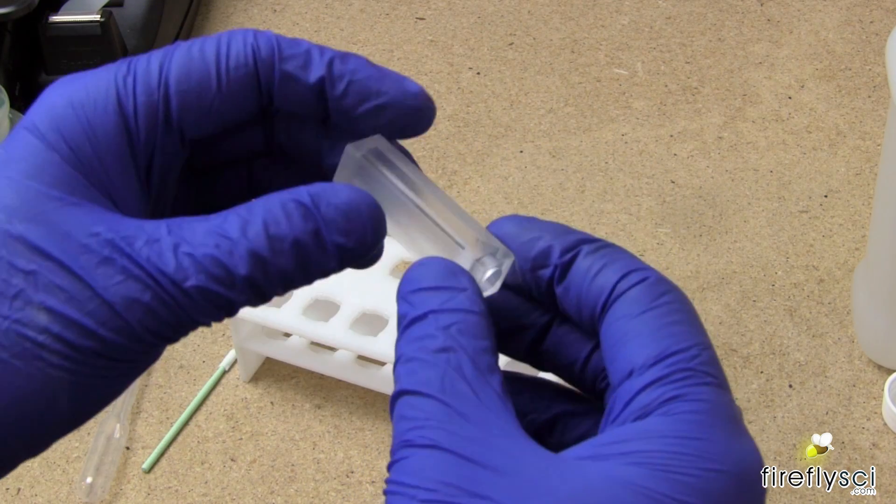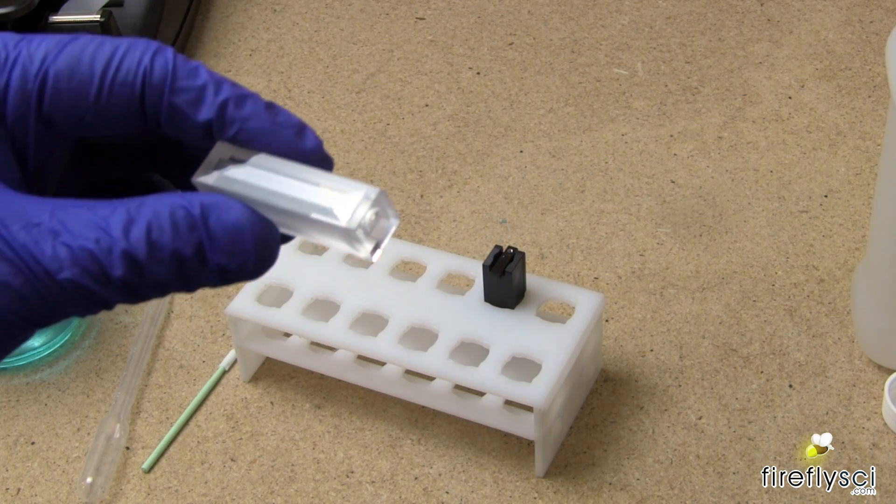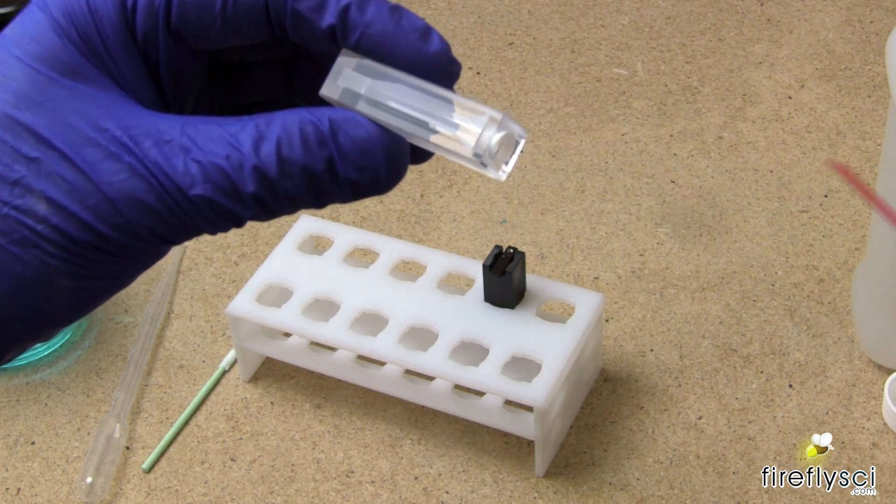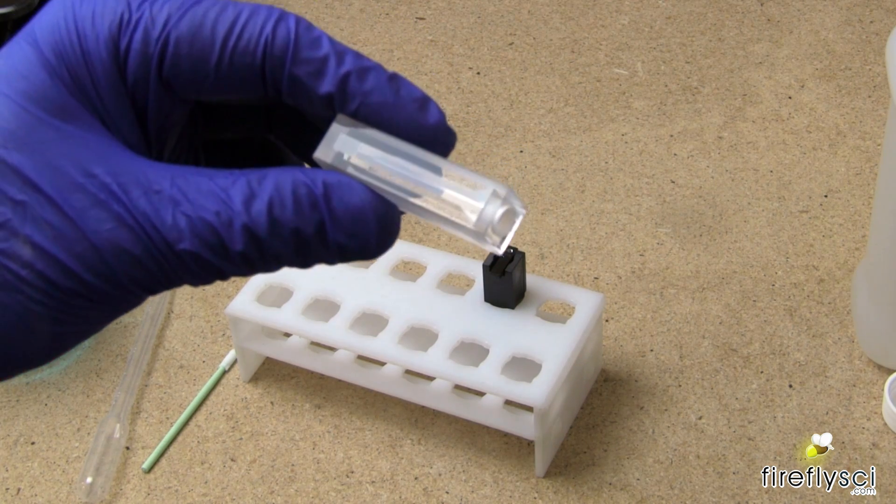Now if you want to quickly dry it after using the alcohol, you can just use a can of compressed air. Just give it a quick shot in the cuvette here. And that just takes like a second to dry.